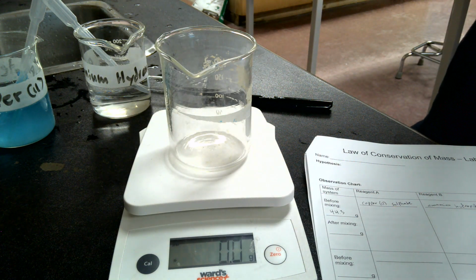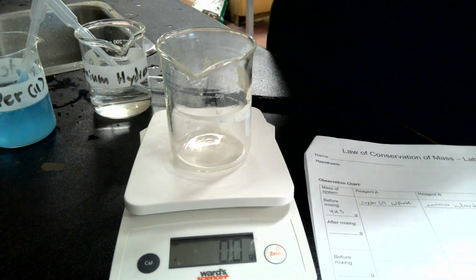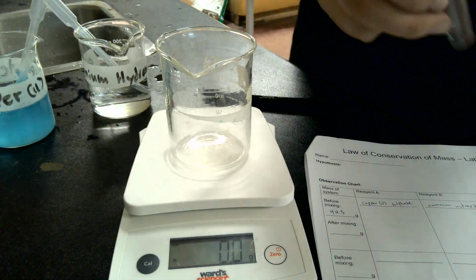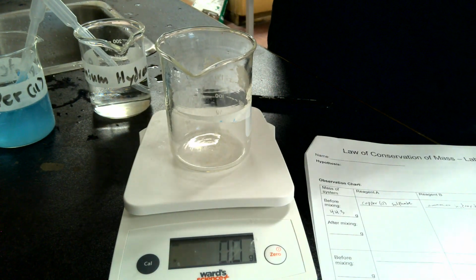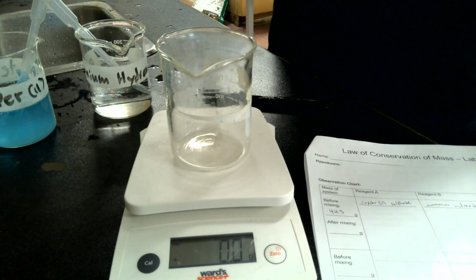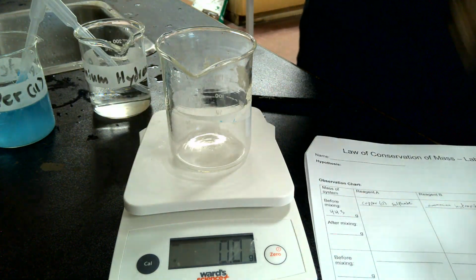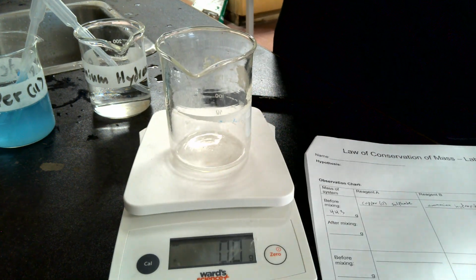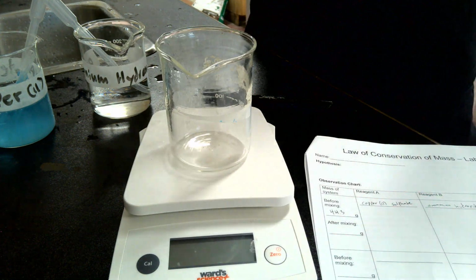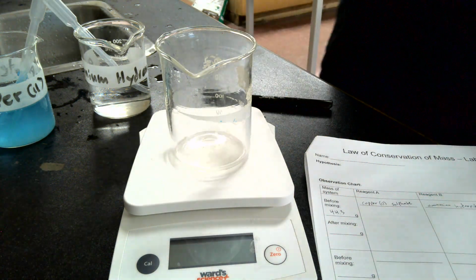So to do this, we are going to actually observe a number of chemical reactions occurring within a closed system. We're going to do that simply by having a big test tube filled with one solution. We're going to stick a smaller test tube inside of it with another solution so that the two don't mix. And then we're going to be stoppering them, therefore creating a closed system, weighing it, mixing them, and then weighing it again. And the idea is that you should see that there is no actual change in mass.